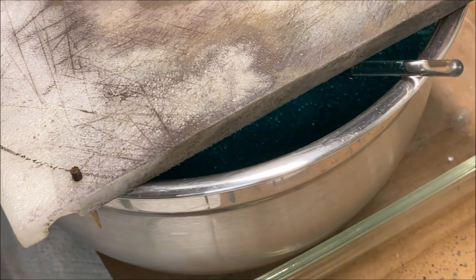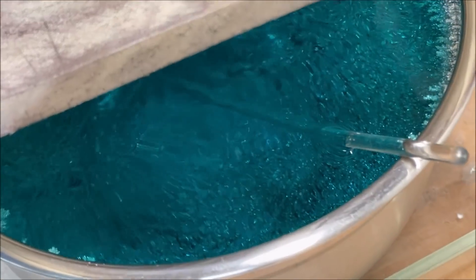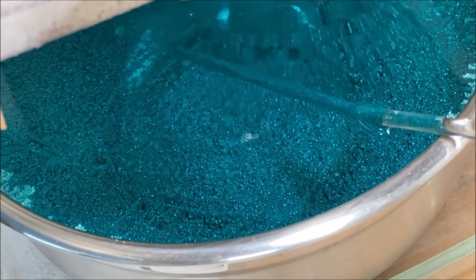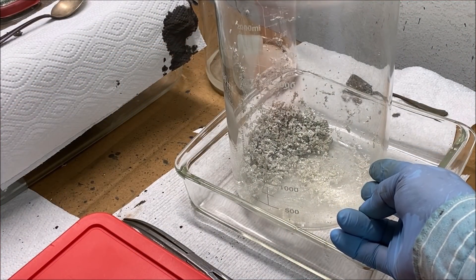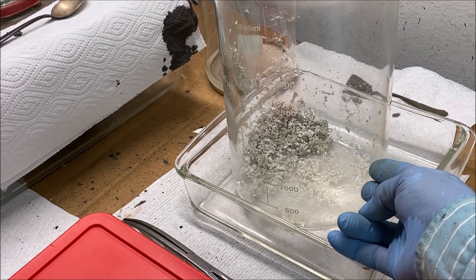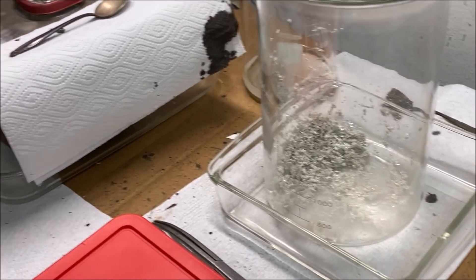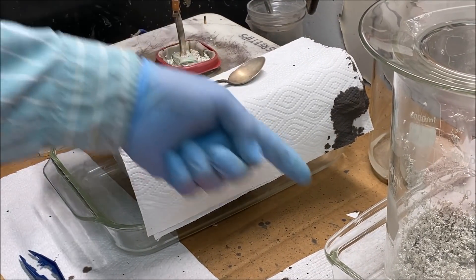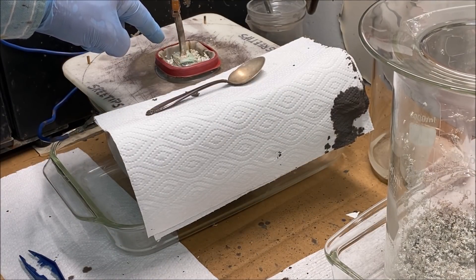Two days growth — actually today's Thursday and I started this on Monday, so that's three days worth of growth down in the electrolytic silver cell. This is pure silver crystal that was discolored. If you remember from my previous video, what I did is I restarted the cell and I fed this pure silver crystal back into the cell to refine it a second time.